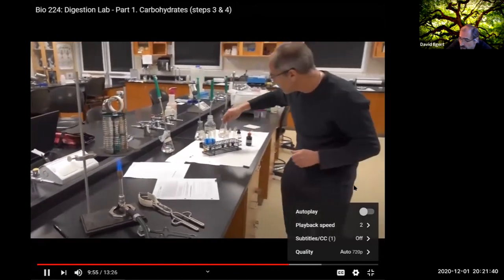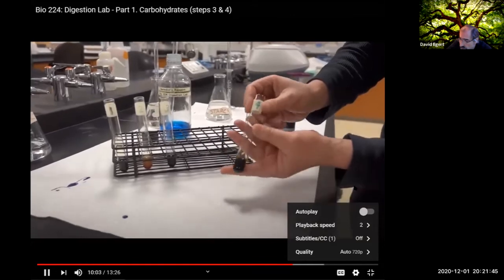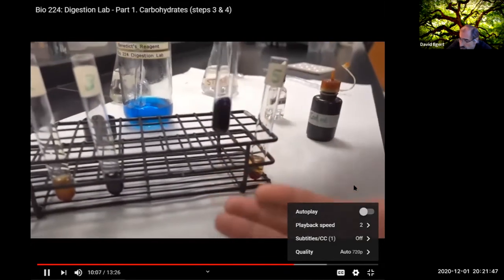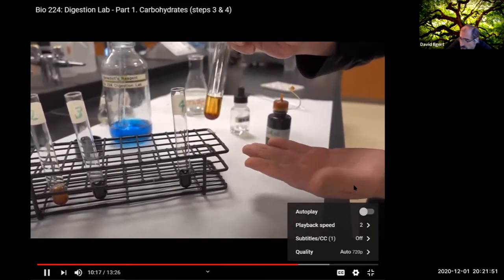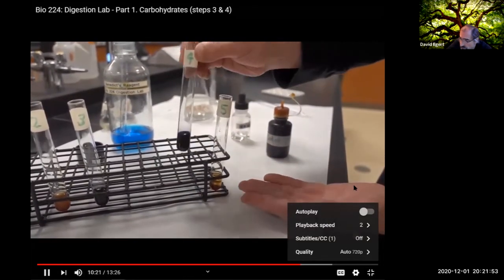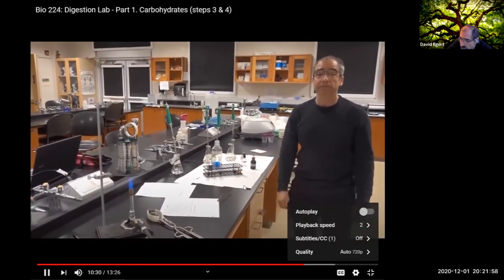So again, just to show you with the starch, pure starch is going to have this very strong reaction where you get this purple black. And in the case of the maltose where there was no starch present, we can see the iodine just stays this kind of amber color. So this was no starch at all. This is showing presence of starch. And we'll come back in a couple of minutes when the Benedict solution has had a chance to do its thing.